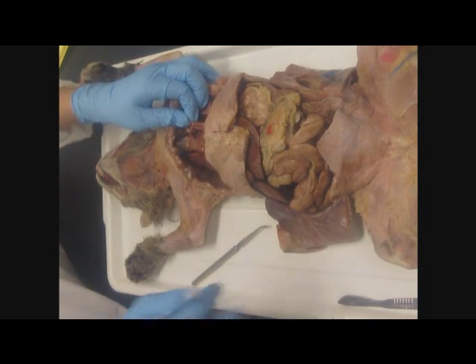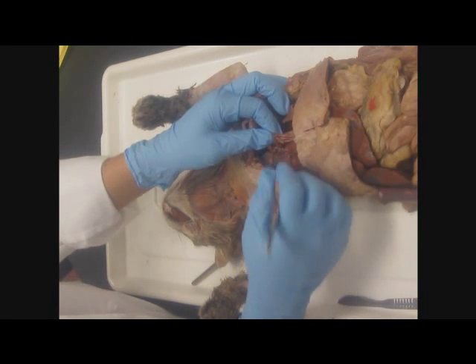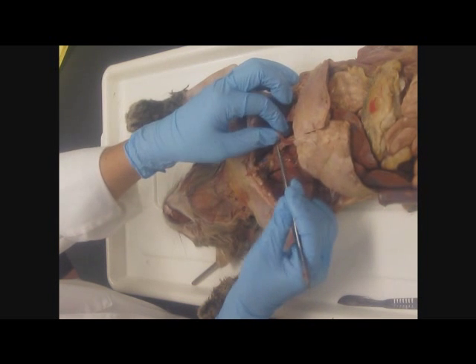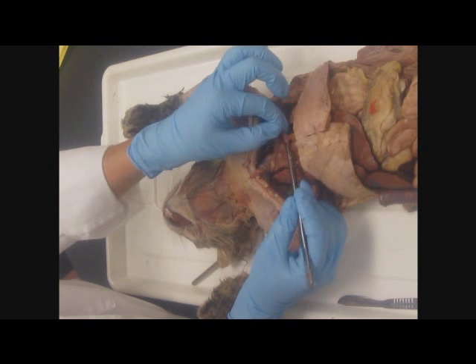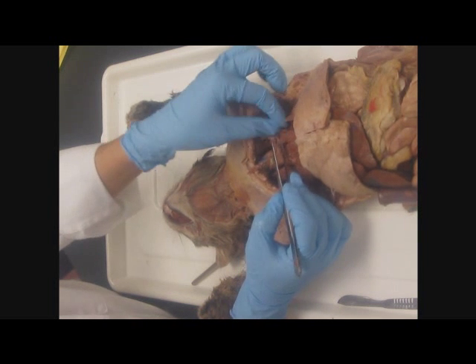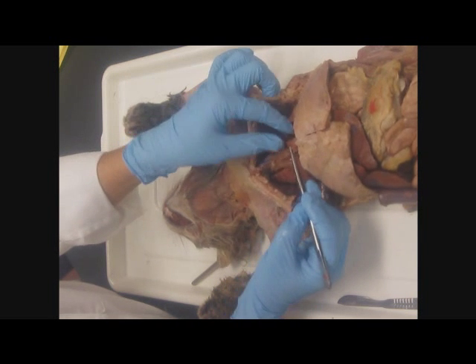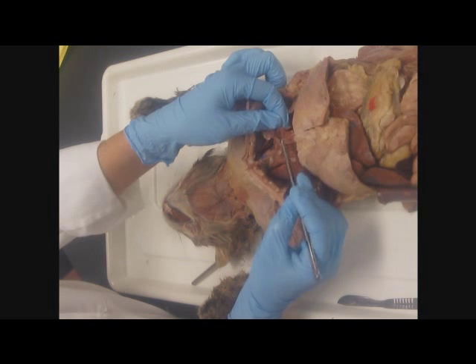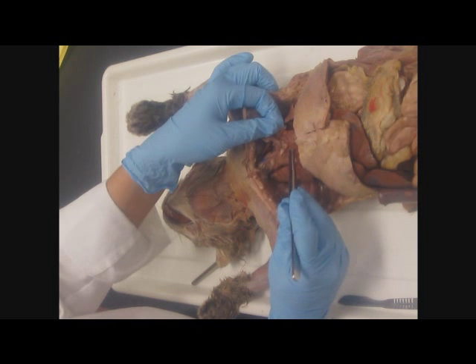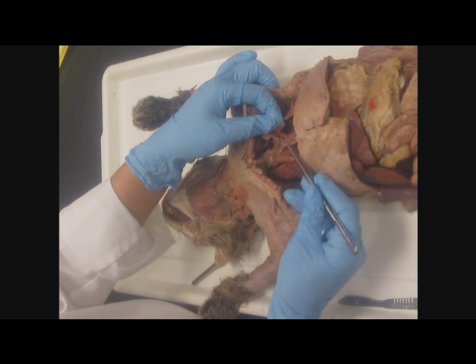Then, if you look closely and pay attention to what you're seeing in this cavity, you actually have two layers to what I'm holding. You have a really tough fibrous layer, and I can pull on it and it doesn't tear. And then this layer comes easily away. This layer is the mediastinal pleura. The fibrous layer, this one, is the parietal pericardium. So you have three layers here. On the heart, visceral pericardium. Around the heart and fibrous, parietal pericardium.